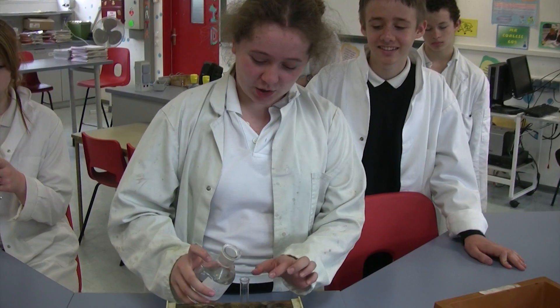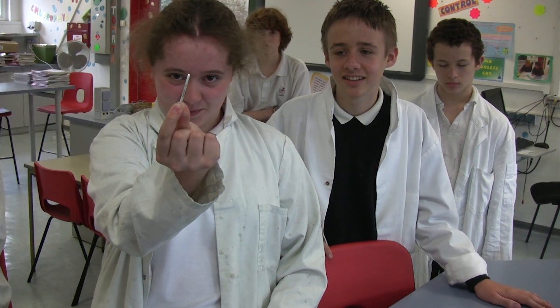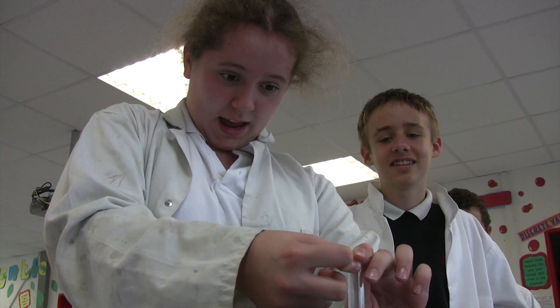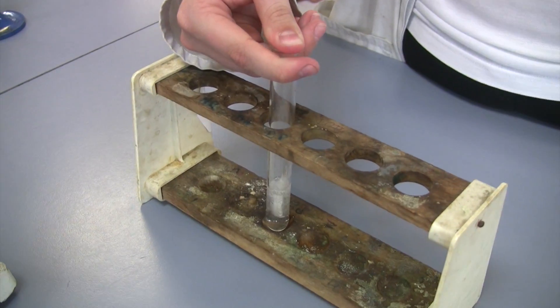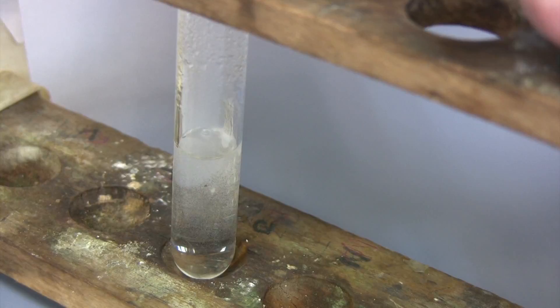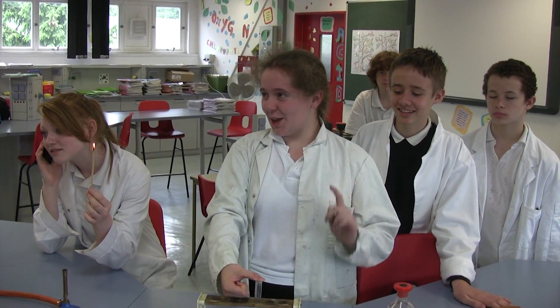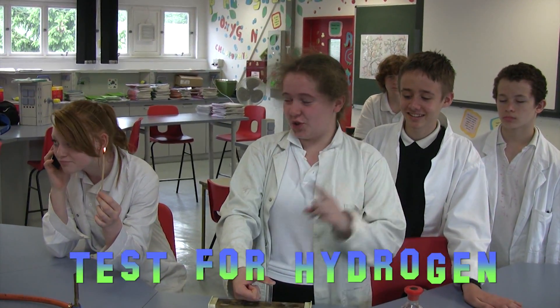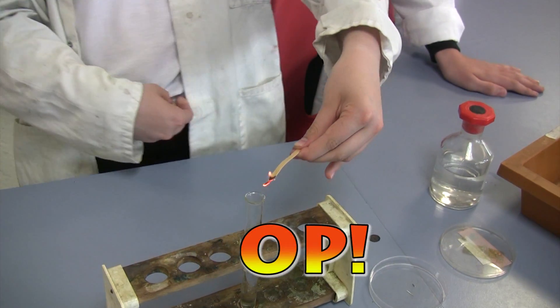I'm now going to put in the hydrochloric acid, and now I'm going to add in a little bit of magnesium. And now I'm going to put my thumb over it. I'm collecting the hydrogen gas. And I'm now going to test for the hydrogen using a burning splint. There's the distinctive pop that tells us hydrogen gas is produced.